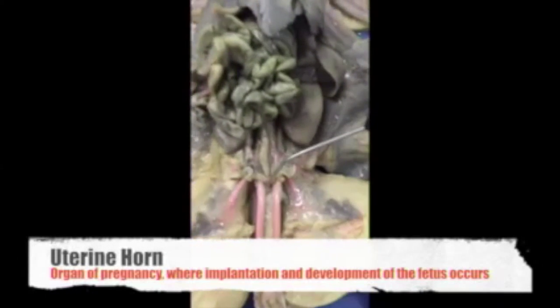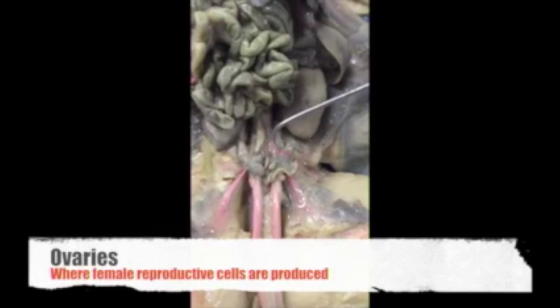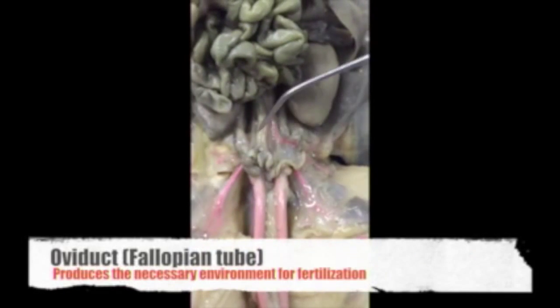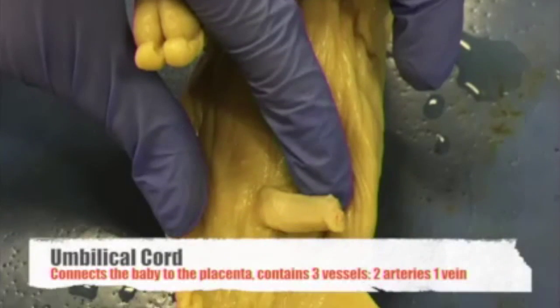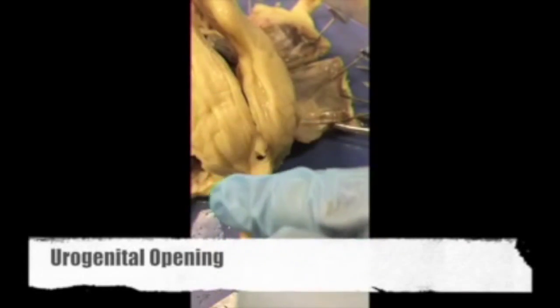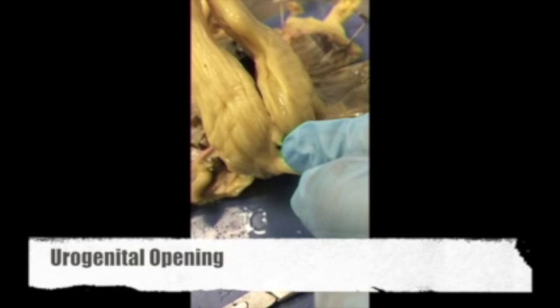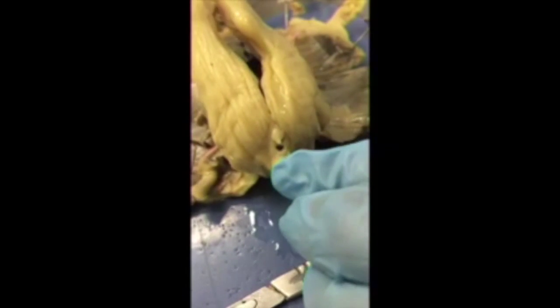This is the uterine horn right here. This is the ovary. This sitting on top of the ovary is the oviduct. We know that this is a female because of her genital papillae right here, the little spike on the end, and her anus.